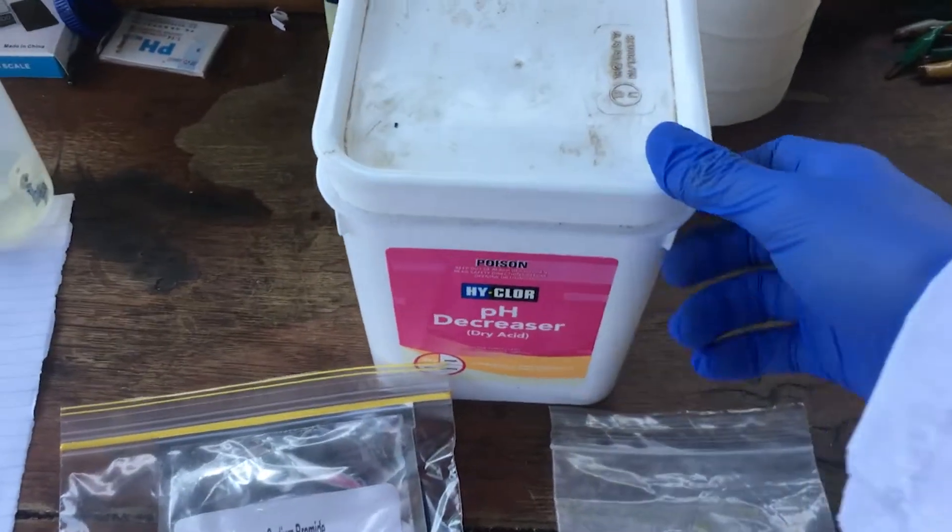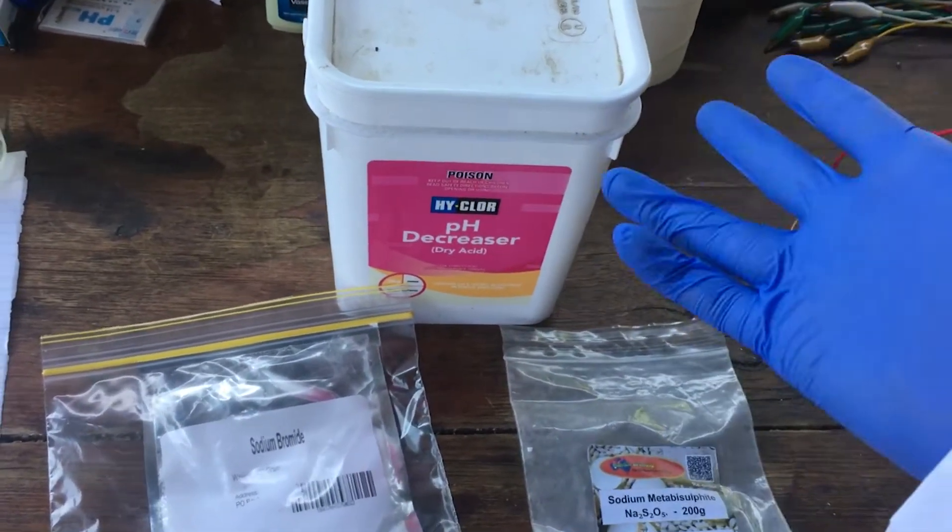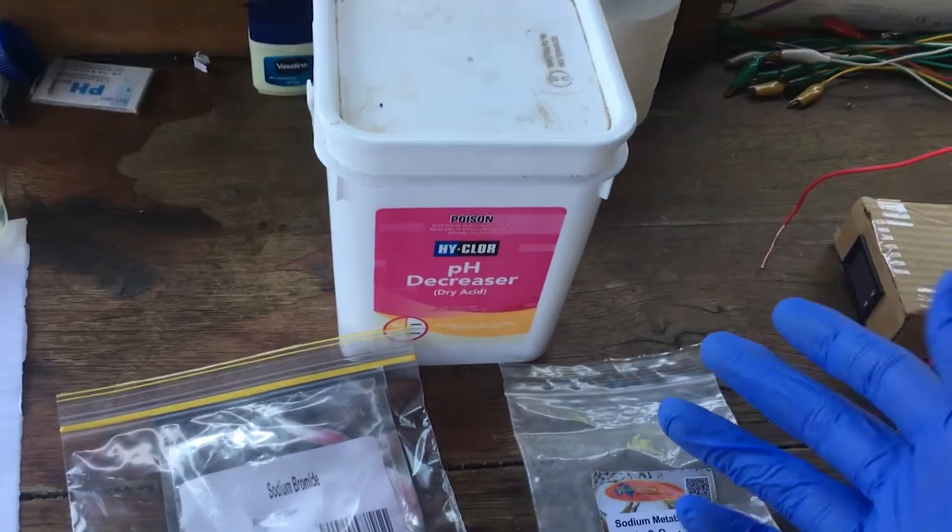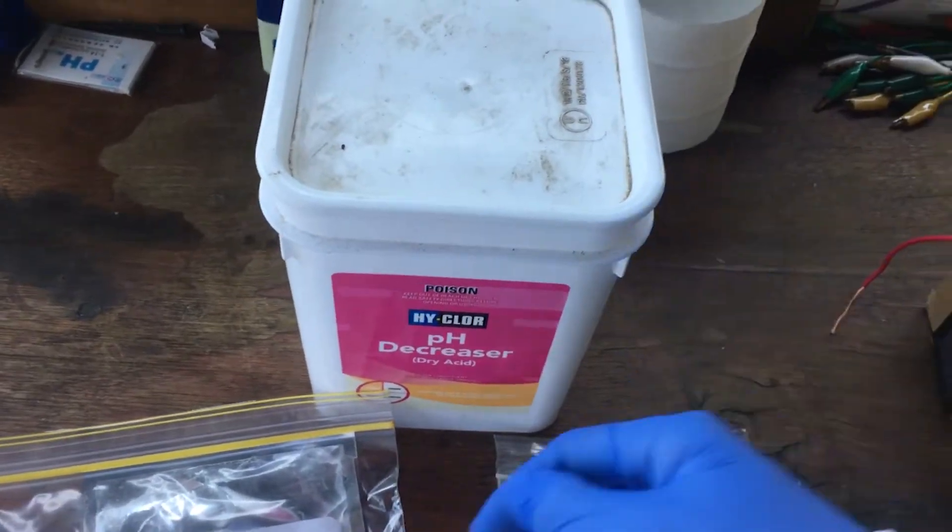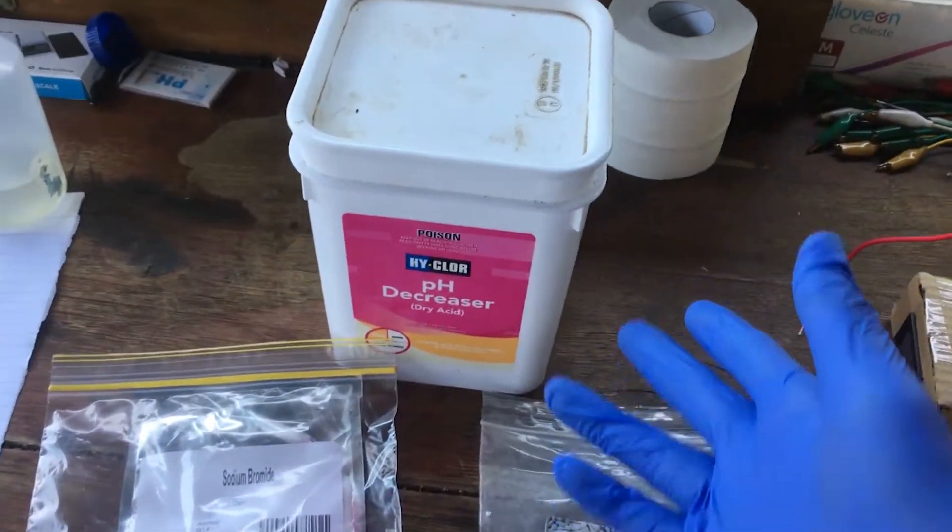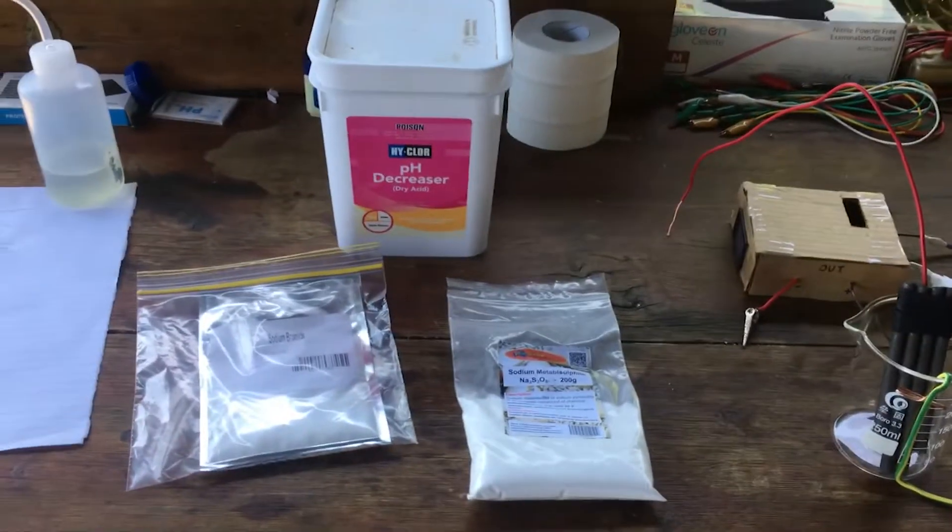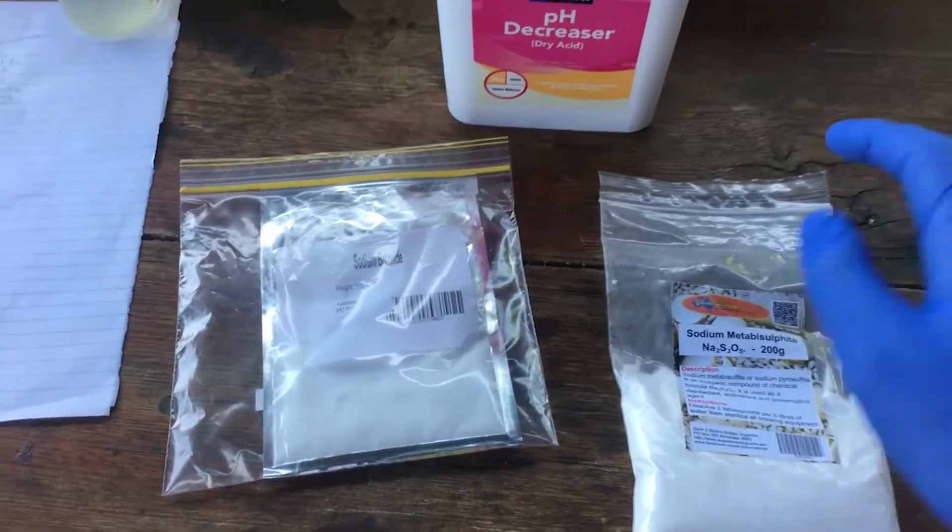The final chemical we need is sulfuric acid, if you can get it. I can't really get it anywhere, at least not in concentrated form. So what I'm going to use as a substitute is sodium bisulfate, which will work just fine for this kind of synthesis. And that's all we need as far as chemicals go, so it should be relatively straightforward.